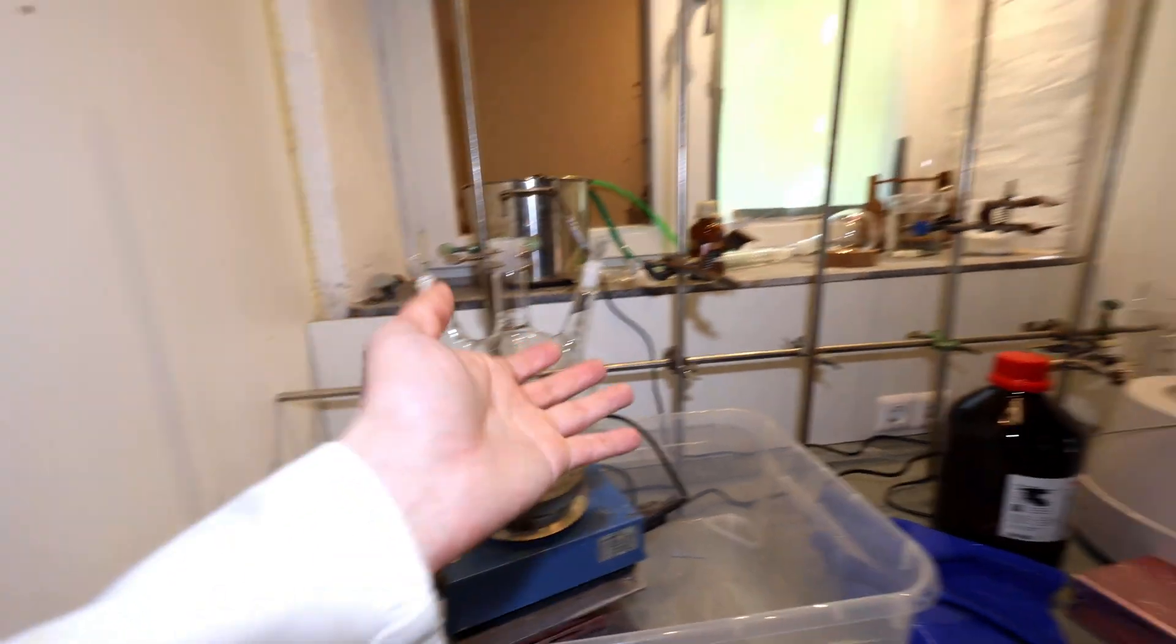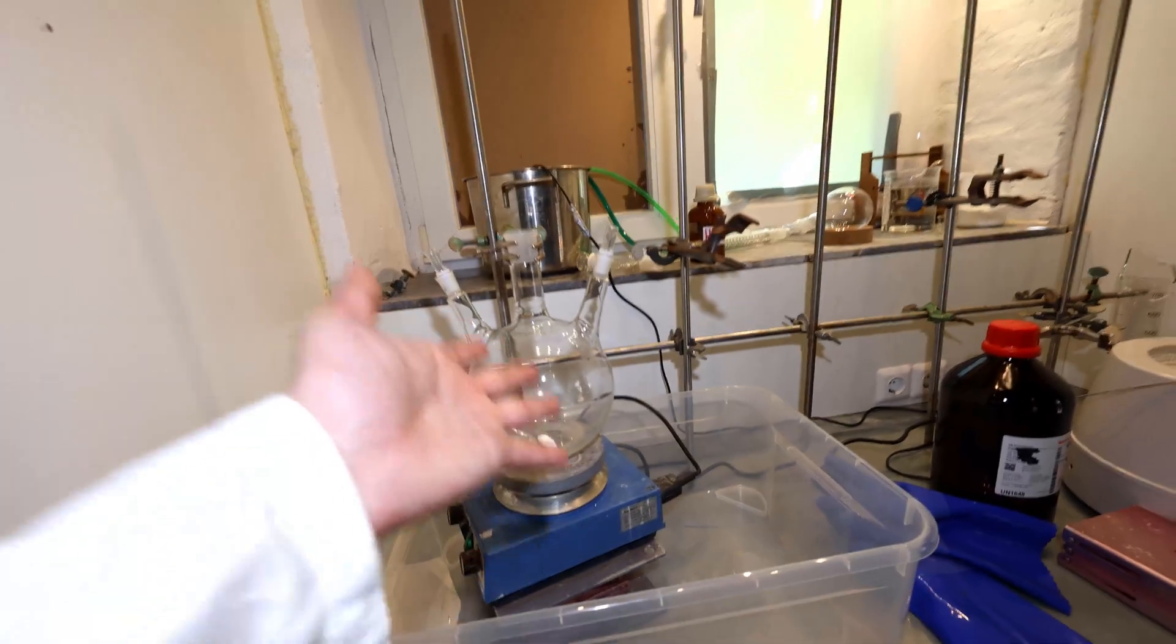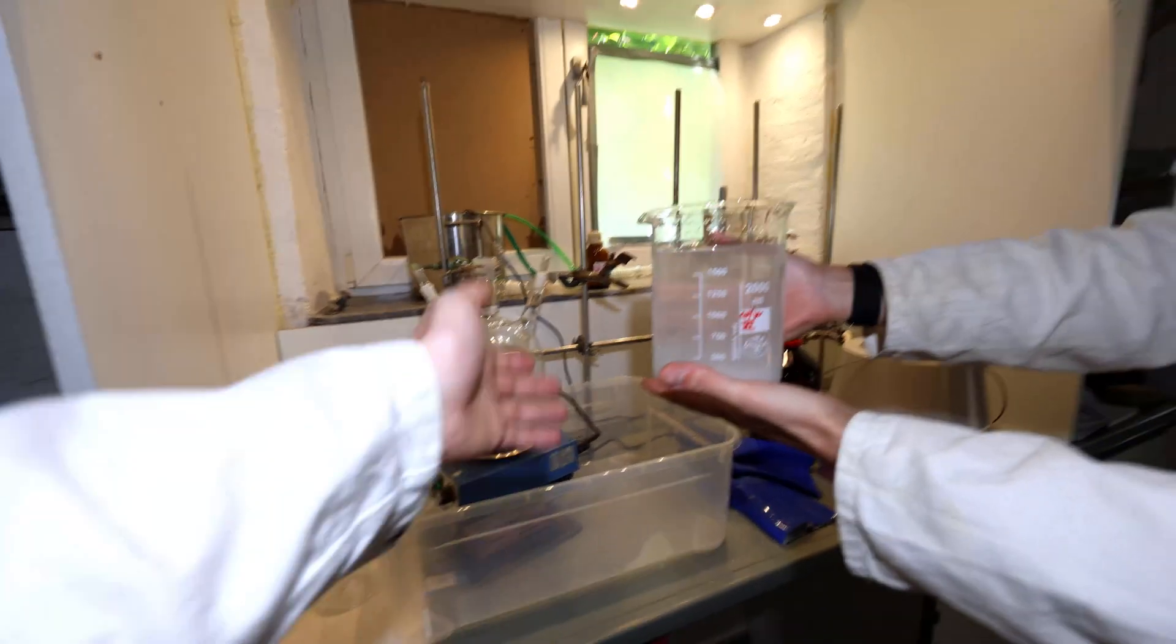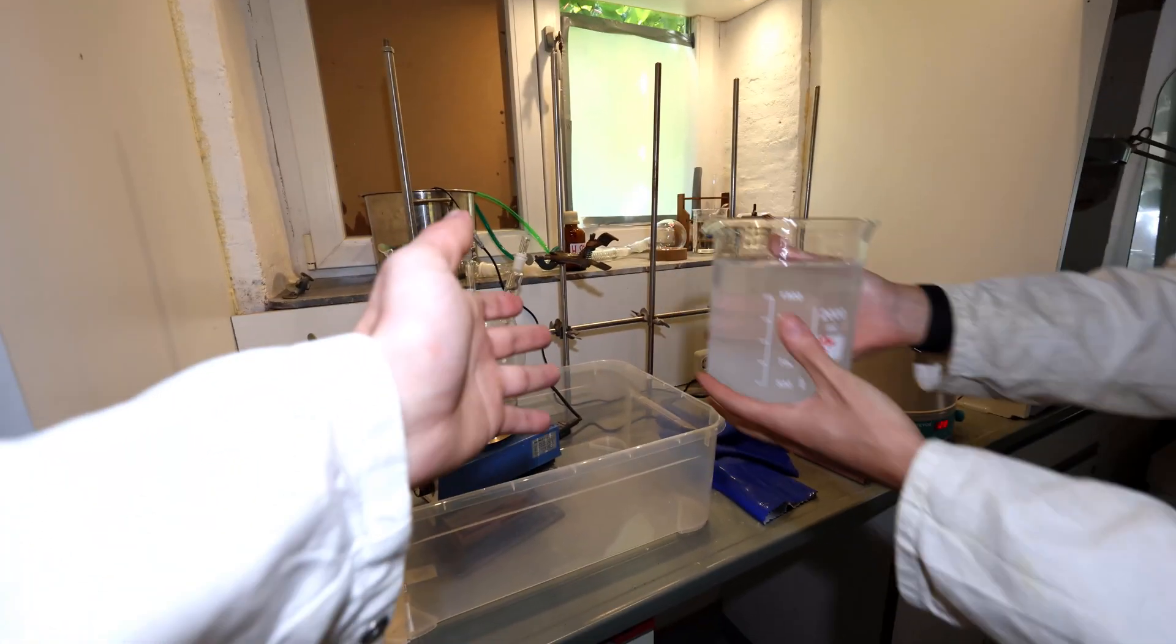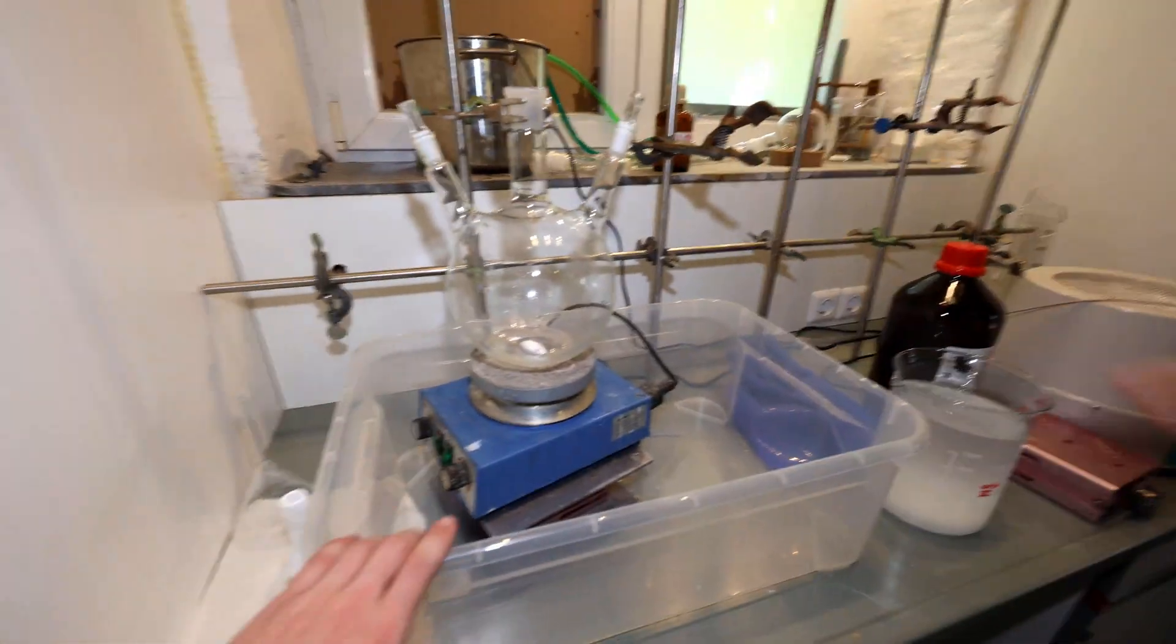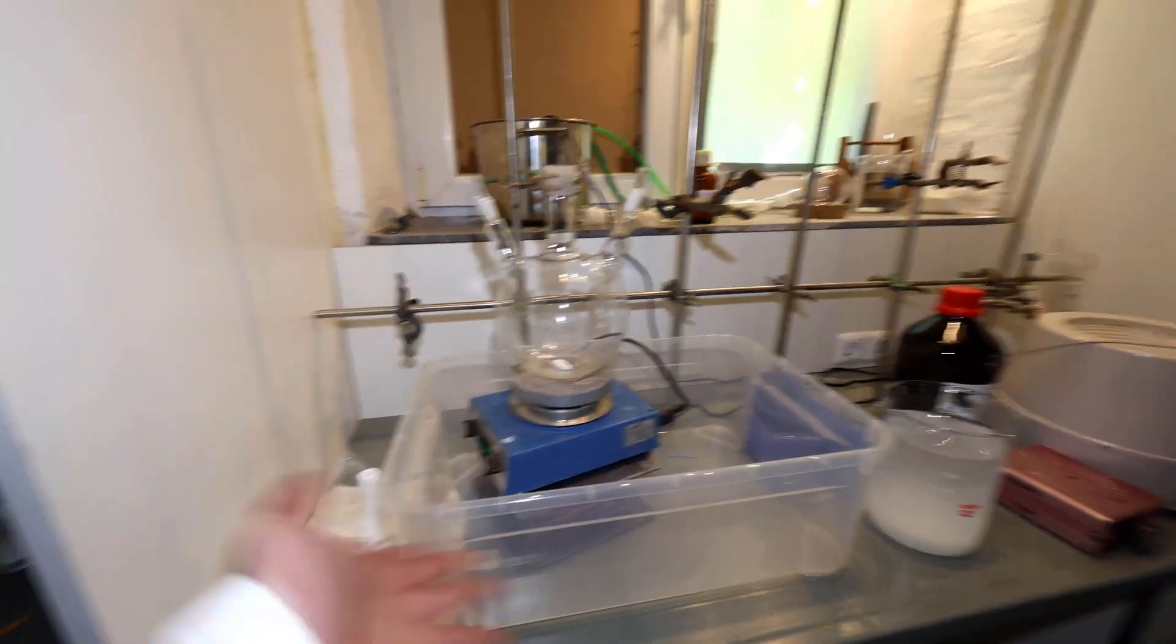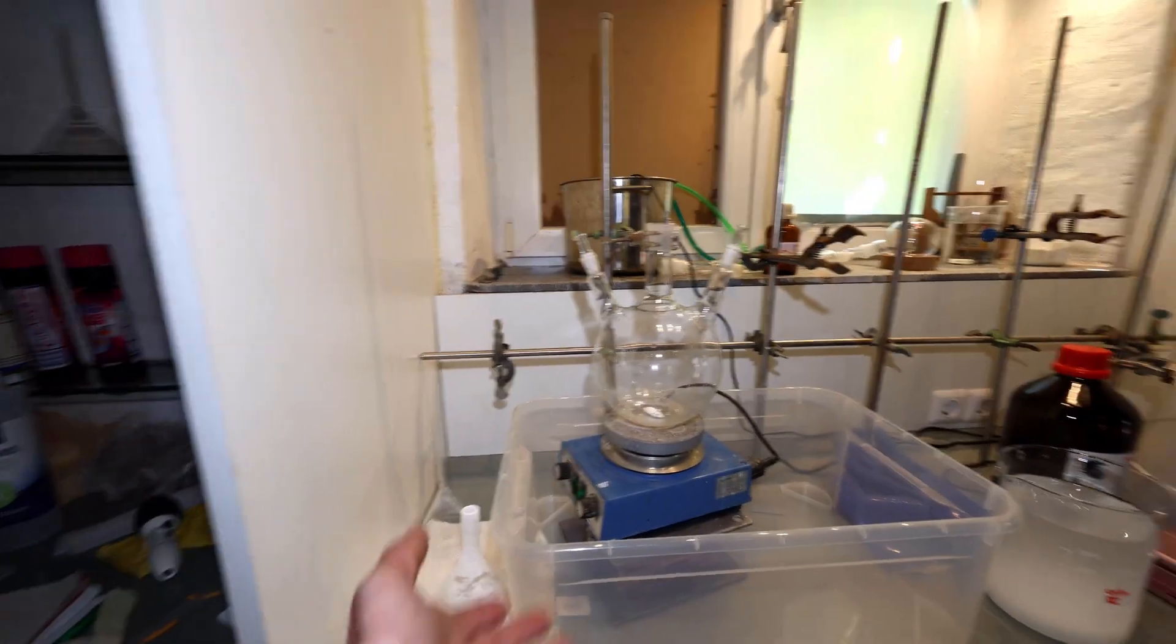I hope I explained this well. We're kind of in a time crunch but yeah let's get this started. And that's our sodium thiosulfate solution in case anything goes wrong. Also we have the thing if the bromine spills, it will spill in here and not get everywhere.